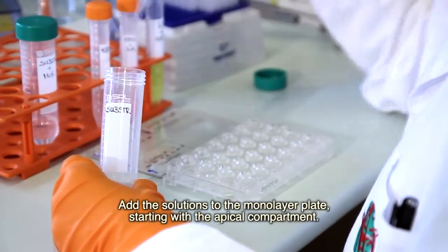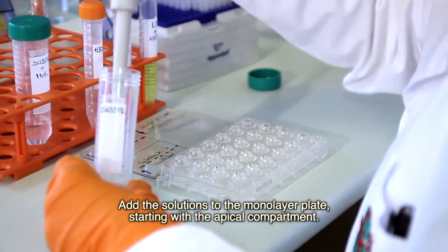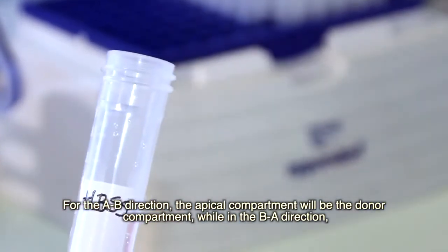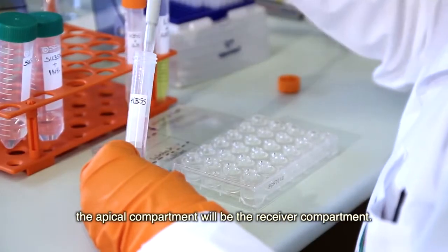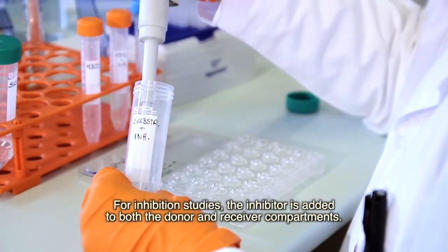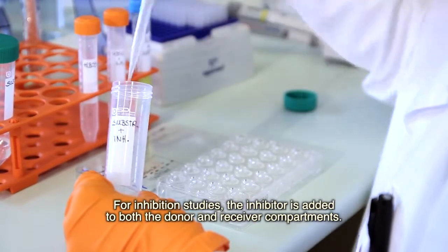Add the solutions to the monolayer plate, starting with the apical compartment. For the A to B direction, the apical compartment will be the donor compartment, while in the B to A direction, the apical compartment will be the receiver compartment. For inhibition studies, the inhibitor is added to both the donor and receiver compartments.